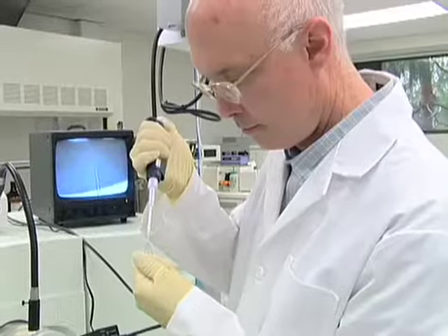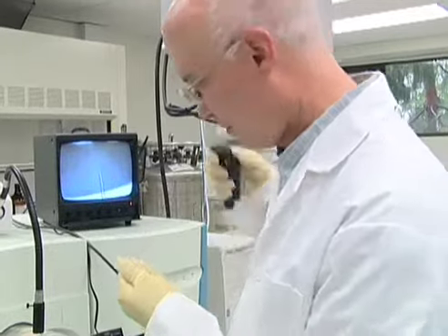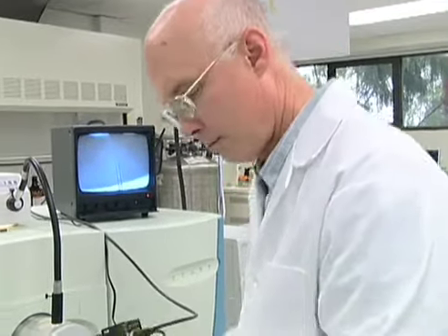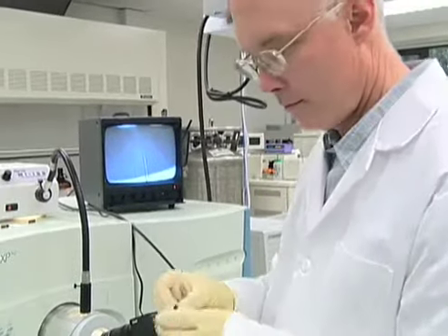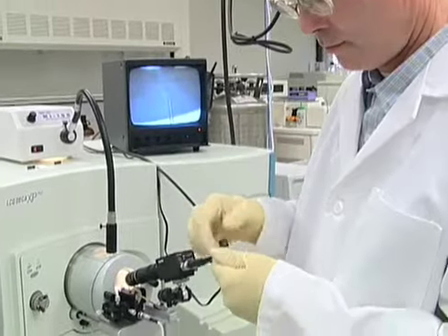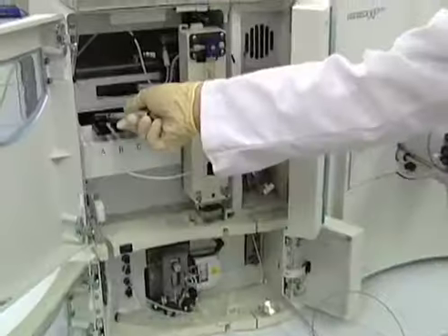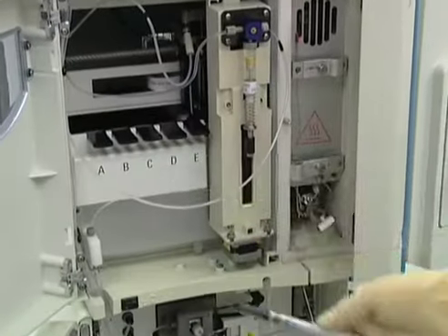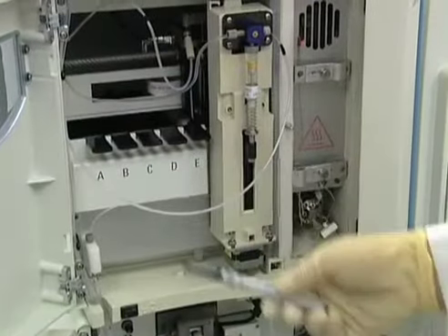The next day, we separate the proteins further by using the fractionator. This machine will separate individual proteins into their own tube.